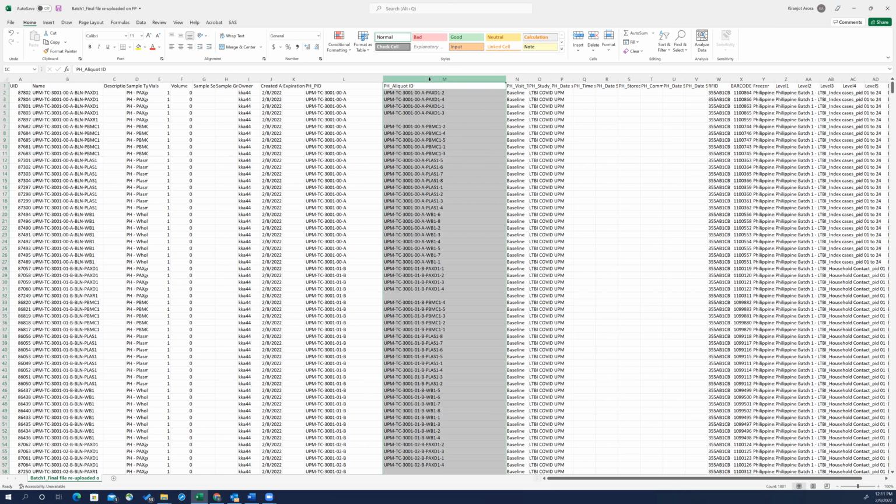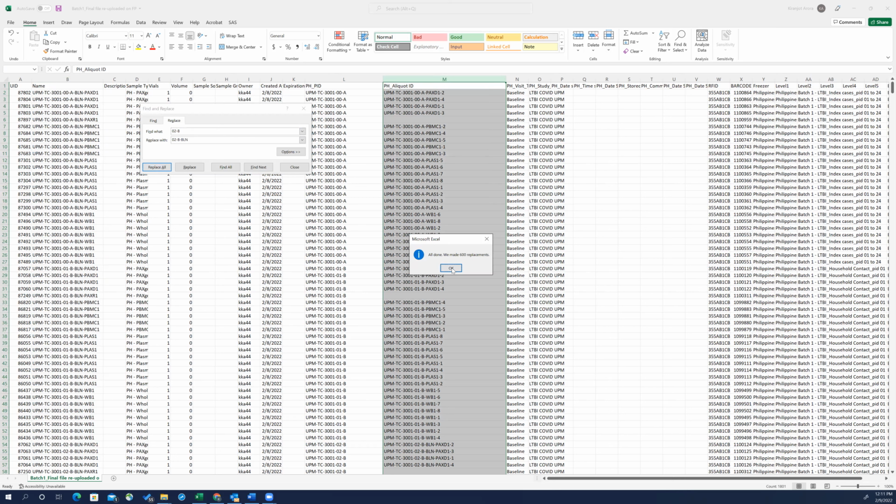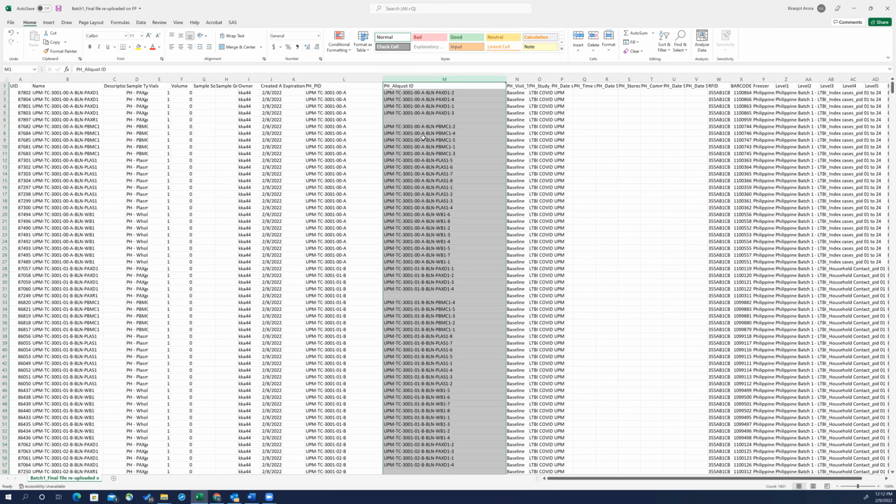So again, select the column where you want to add changes, Control F, and then click on replace, and I'll just start with this one first, replace all. So 600 replacements are done here, and then I'm going to select one here, and replace all. 600 replacements are made, and then A, and all the A's are the ones that have 00 here. So make some changes here. A, replace all. 600 replacements are made.